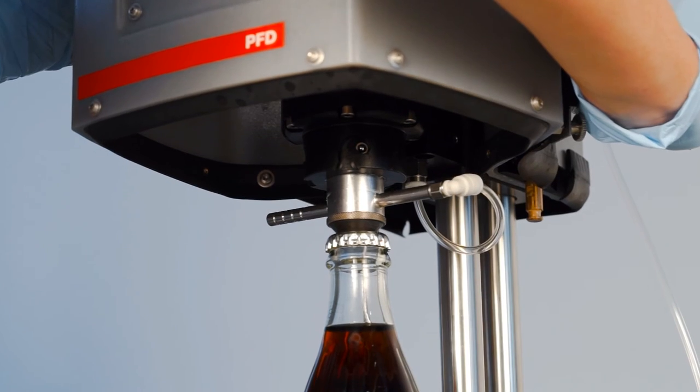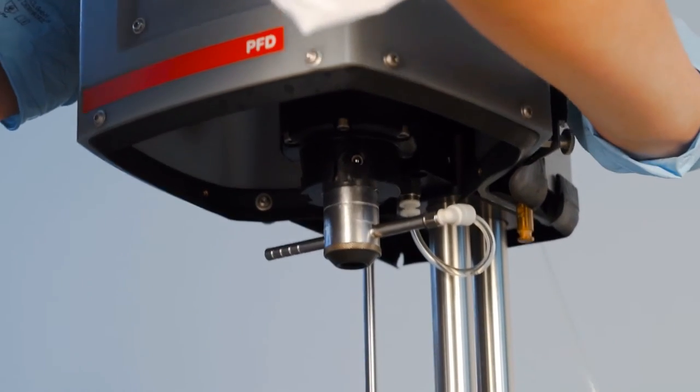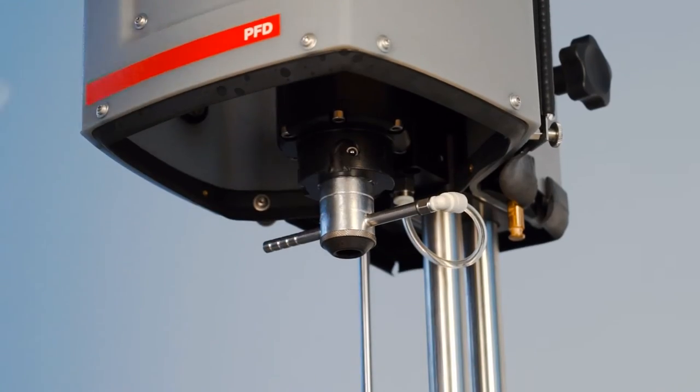Lift the handle to easily remove the container. In case you are going to change the package type for the next measurement cycle, you might need to change the height as well.